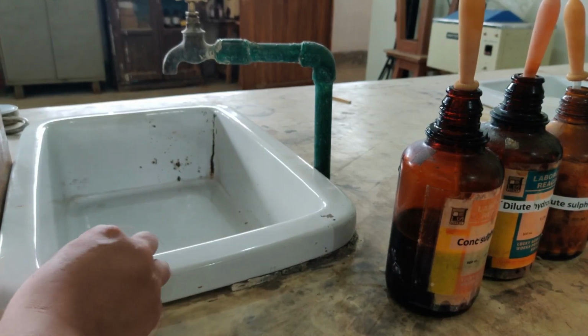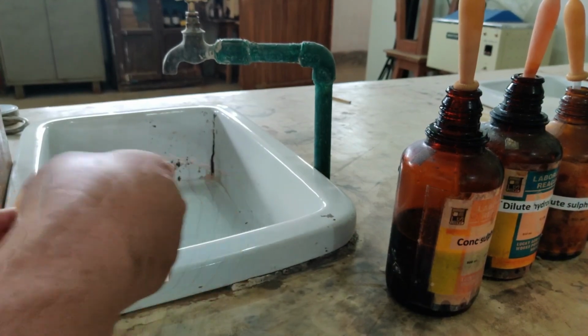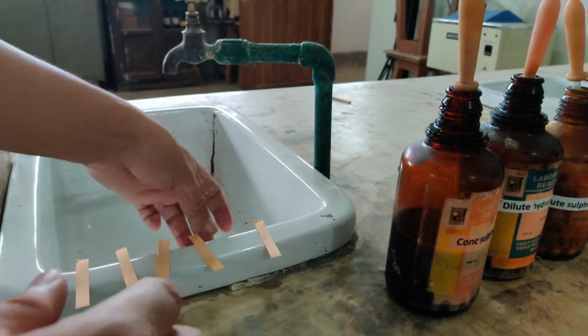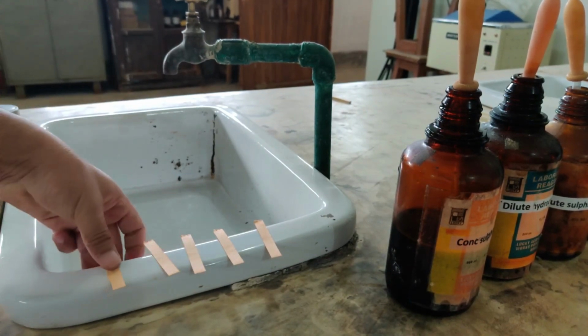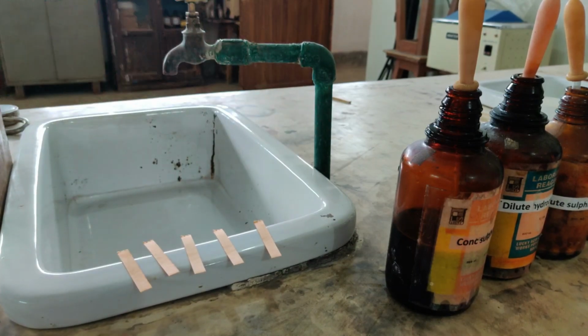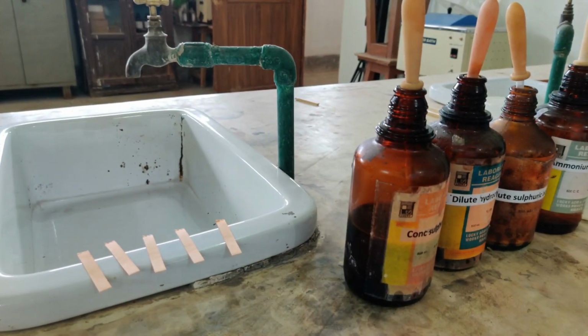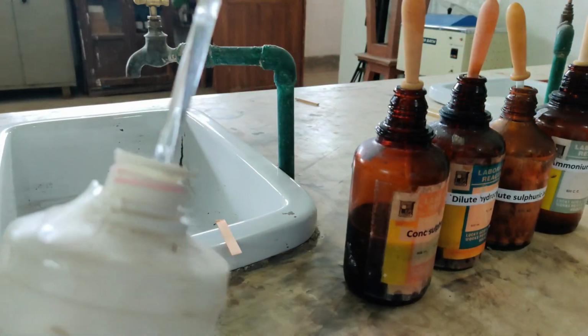see the color changes. So let me keep one here, second one here, third one here, fourth one here, and fifth one here. So here are the 5 strips, and I am going to test these 5 strips of paper by using different solutions. And again I should tell you that since the pH of the different solutions which I am going to take are different, we will see the color change also will be different. So I am first starting with sodium hydroxide. Let's see what happens when I am using sodium hydroxide solution.